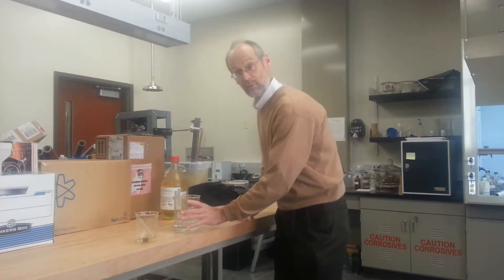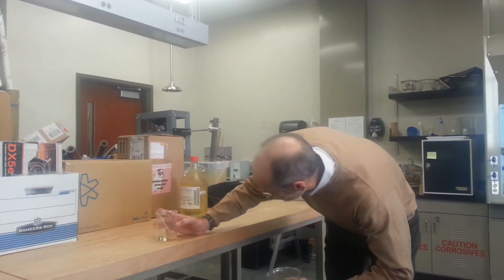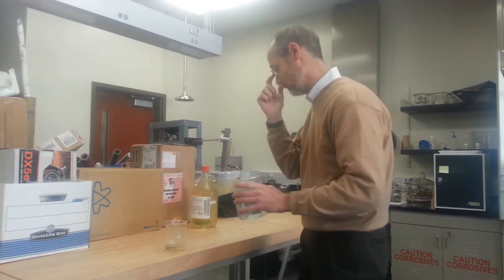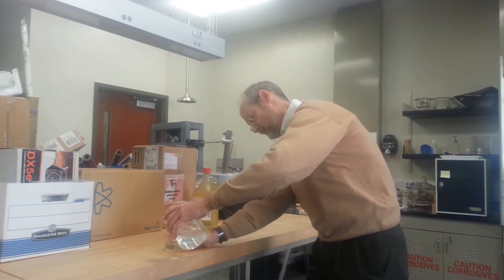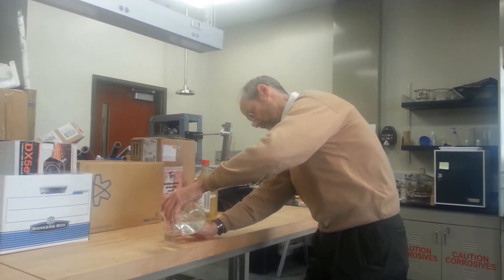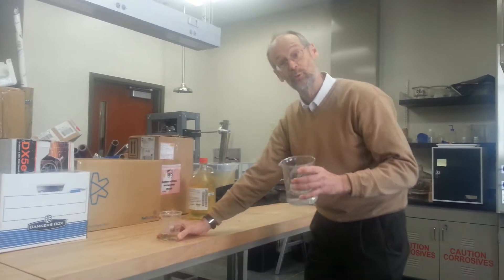So I'm going to try to be really careful when I do this, and I'm going to try to basically double the volume here. I've got a little over 50 mils of concentrated acid in there; I'm going to try to go up to around 100. See how warm that feels — the beaker feels warm. There's steam coming out of it. There's definitely some heat being generated there.